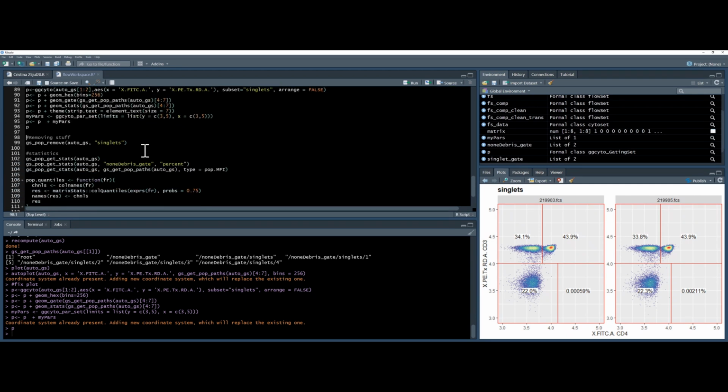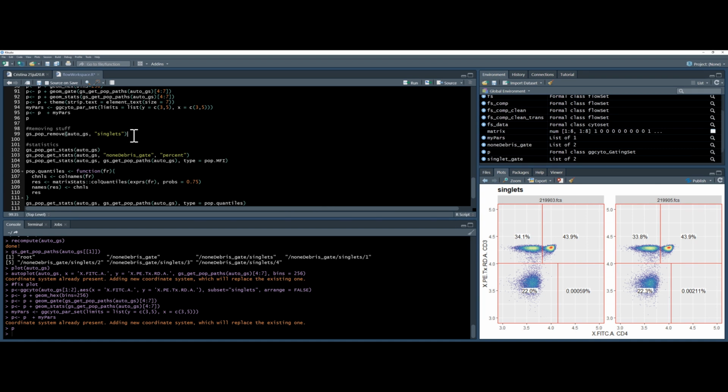Okay, so let's have a look at a few other commands. Number 1, if you make a mistake and want to remove a gate, you can use this gating set population remove command, and you can ask which gate you want to remove. Sadly, you can't group more than one gate at a time, so you have to do one at a time.